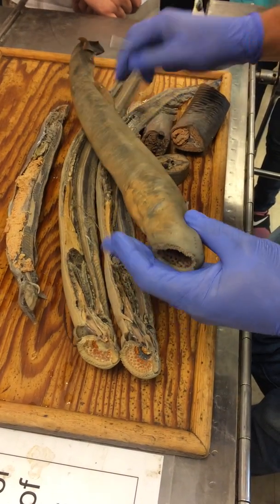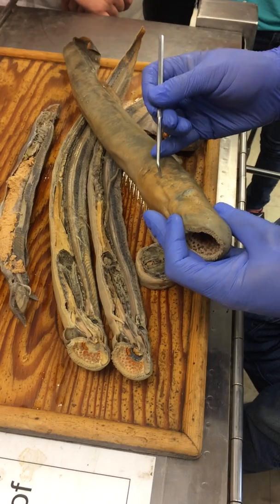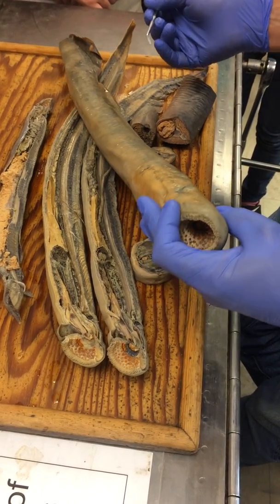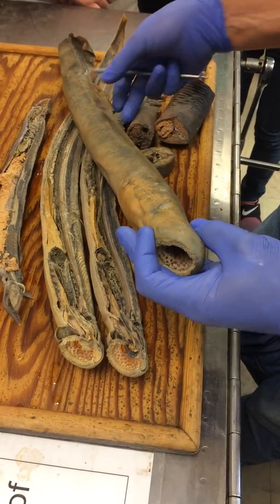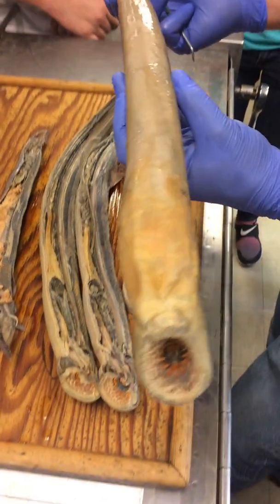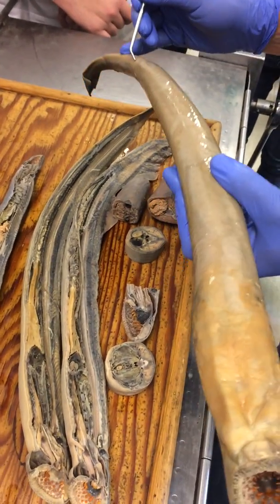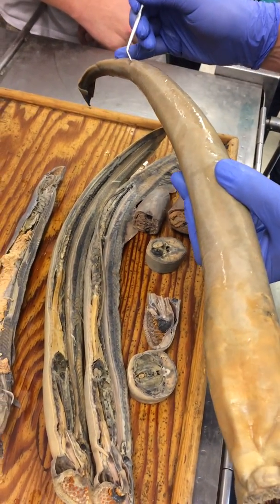External gill slits — I think those are kind of obvious. Myomeres you can't really see very well from the outside. And the reason I got the whole one mainly was to just clarify some of the terminology around the opening here.